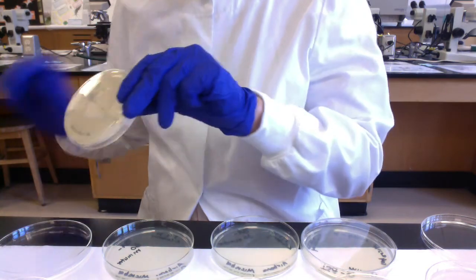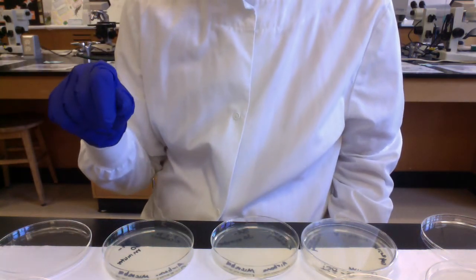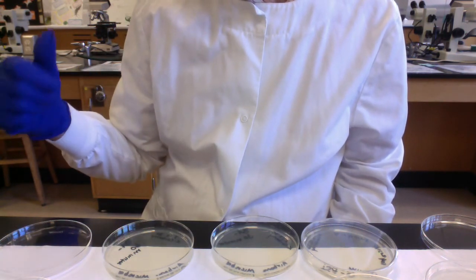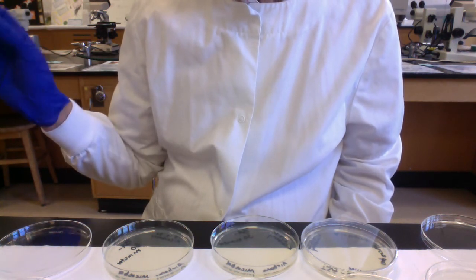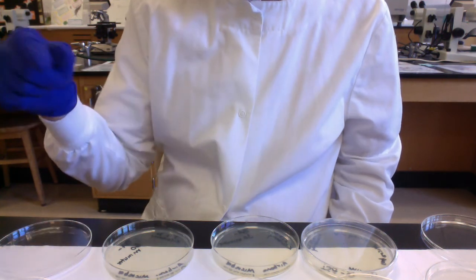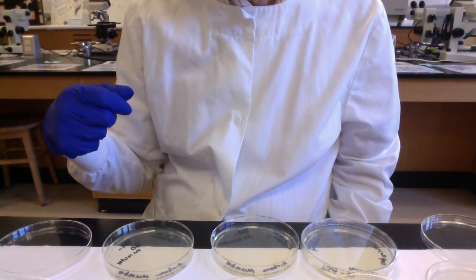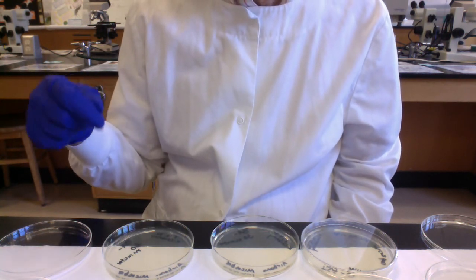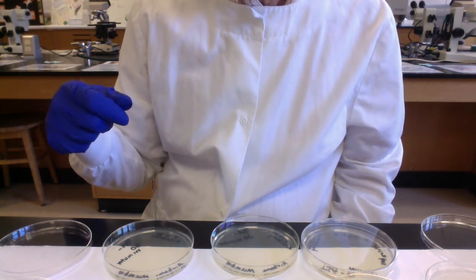I think what I will do, folks, is when we do the follow-up video on the airborne plates, since actually showing you different plates with different colonies isn't working, what I'll probably do is use the photo atlas, or maybe I'll take some of the photo atlas photos of different colonies and incorporate them into a PowerPoint with a voiceover that we'll do for chapter 10. Okay, folks, so we'll finish this little video. There'll be another video to show you the results.